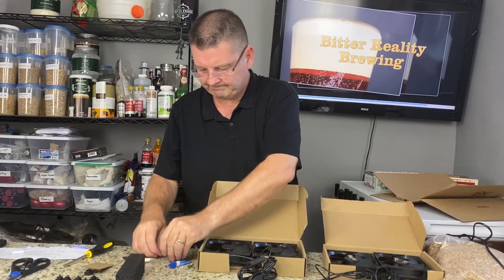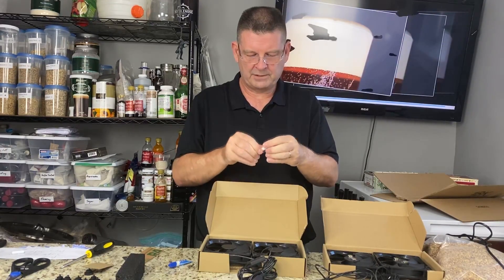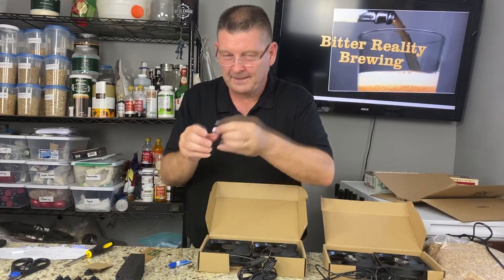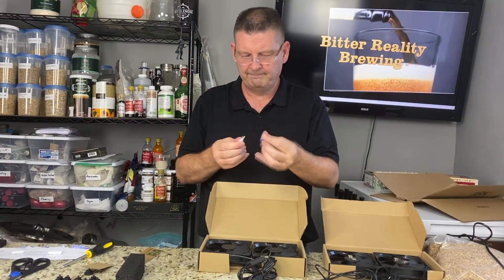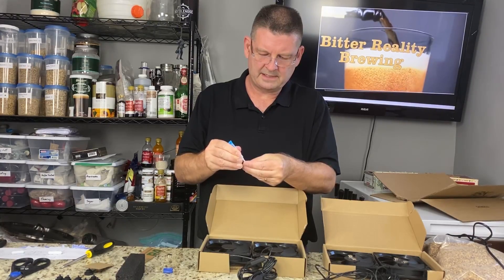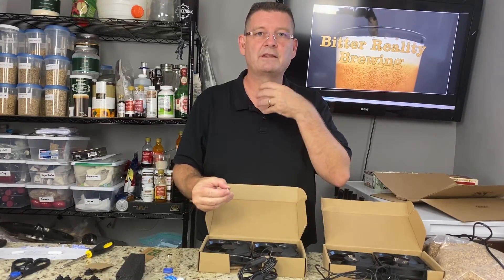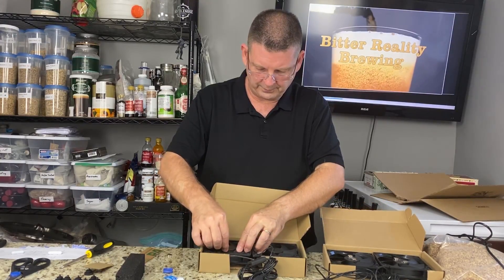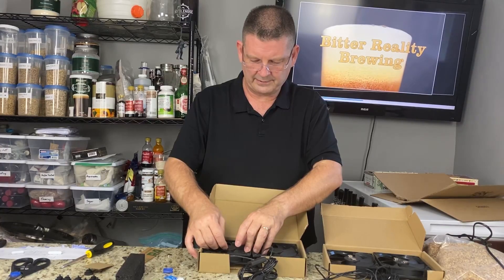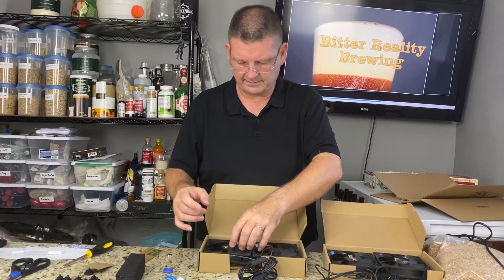Get your earth magnets apart — about the hardest thing to do. Get them on there, make sure they're on correctly, separate them, keep track of which way is up and which way is down. Here's your stir bar. Take your gel super glue and put just a little bit on the bottom. Do not get it on your fingers — if you do, fingernail polish remover, the real stuff with the fumes, will help remove super glue. Don't glue your finger to the magnet.